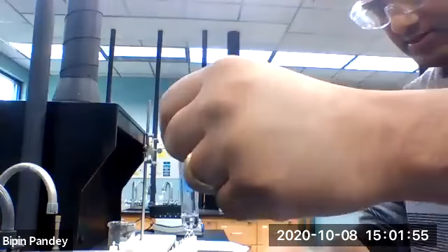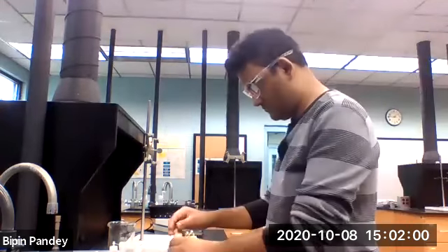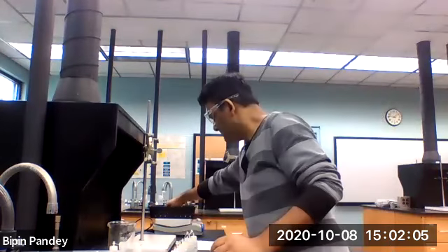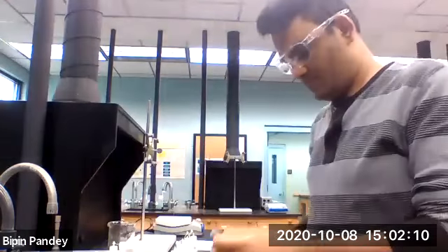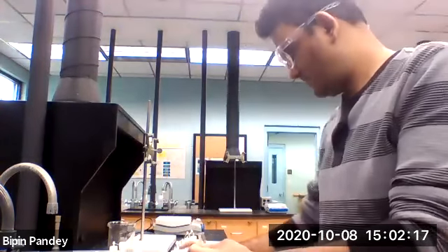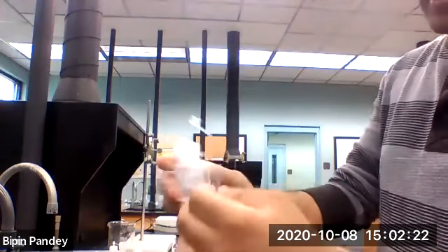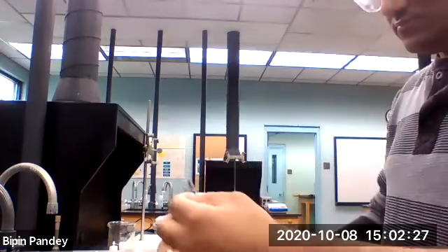Solution is clear, no reaction. 5 drops of lithium chloride, 5 drops of sodium bromide. Again, solution is clear.